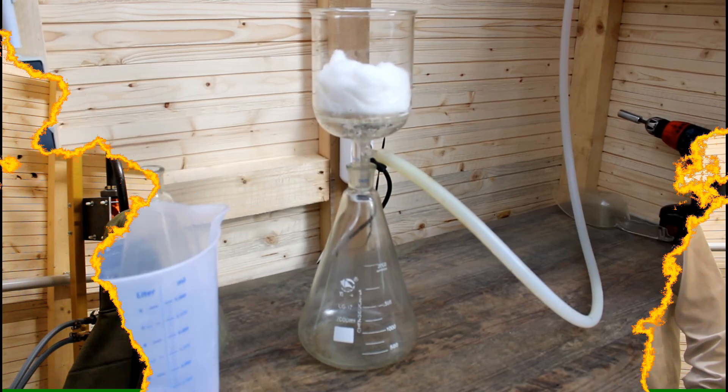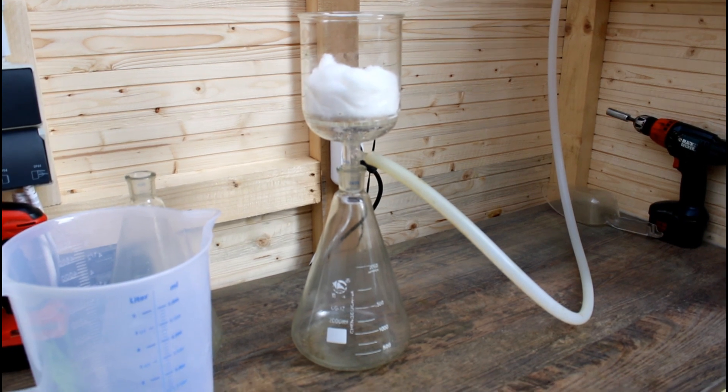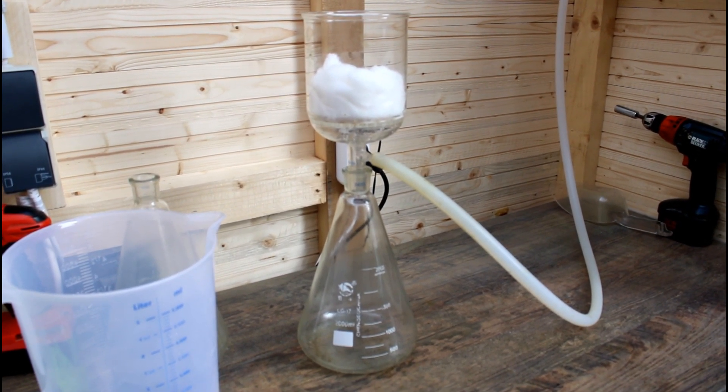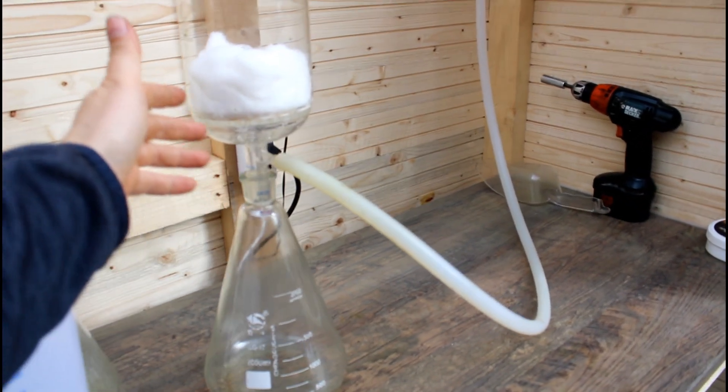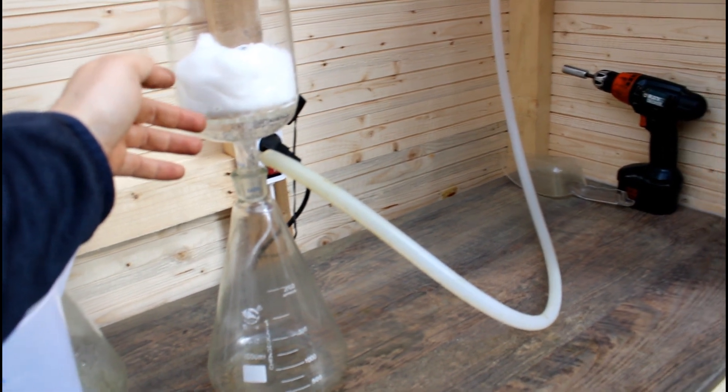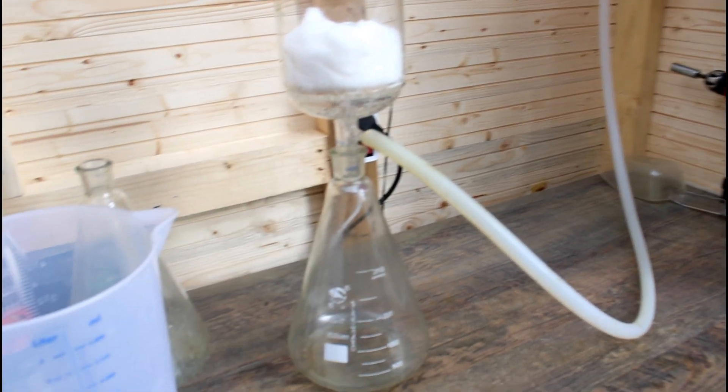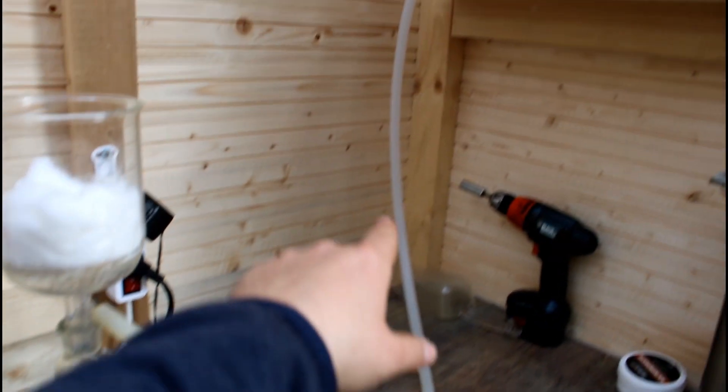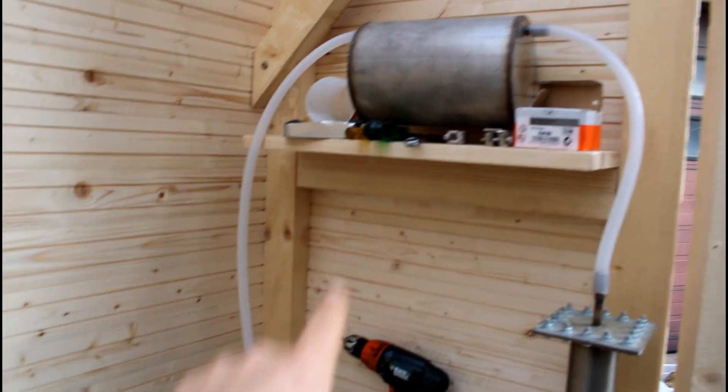So now I'm coming to the last step, it's the filtration of the tincture. And this is performed with a vacuum filtration meaning I have this filter flask here. I will filter through cotton. Beyond the cotton there is a coffee filter paper.